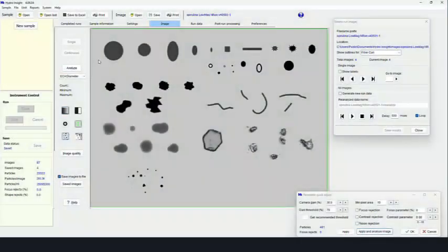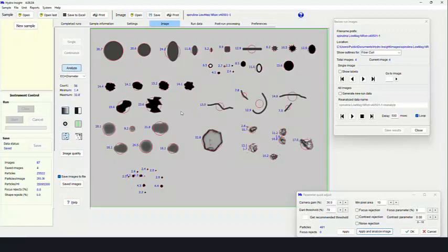So what we're doing here today is just a quick overview of some of the shape measures that are used for fibers. The Insight software has a tool called the shape test image, which is this screen that comes up, and the software will treat this one image as a real image. So we can actually do an analysis of all the particles on the screen with whatever settings are set and rejections or what have you. The thing I wanted to point out today was fiber analysis.